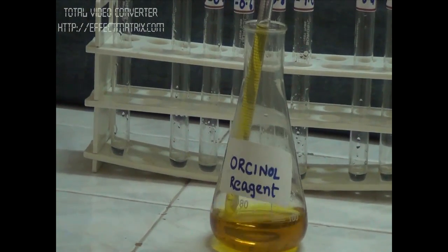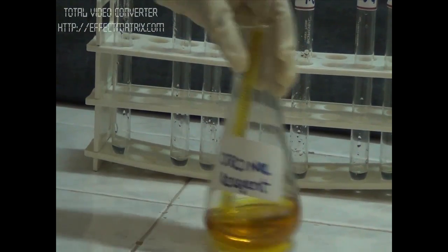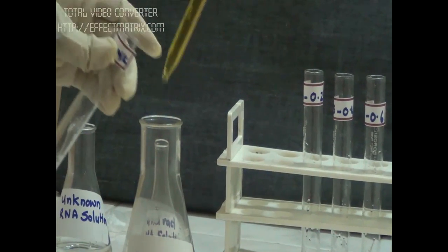So now we have to add our reagent to all the tubes in equal amounts, that is 4 ml.